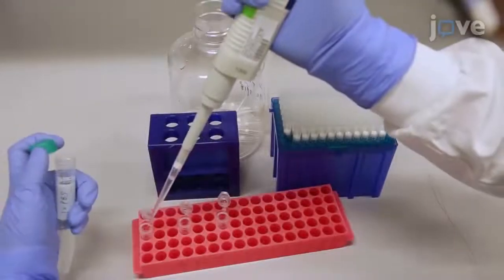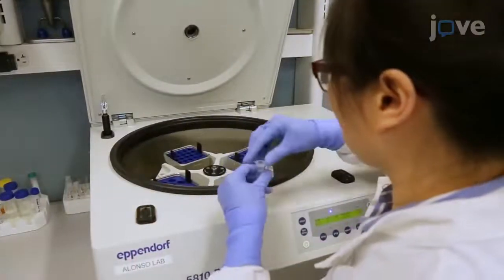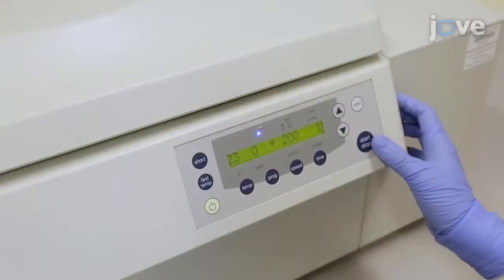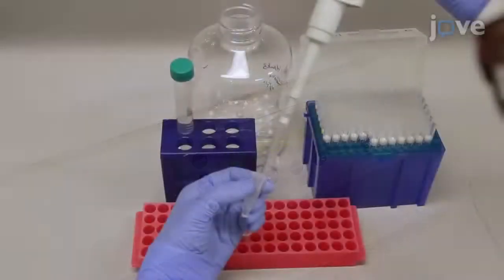Add 1-milliliter of PBS and centrifuge until the speed reaches 200 times gravity and then stop the spin. Remove the supernatant and then repeat the entire PBS wash process.